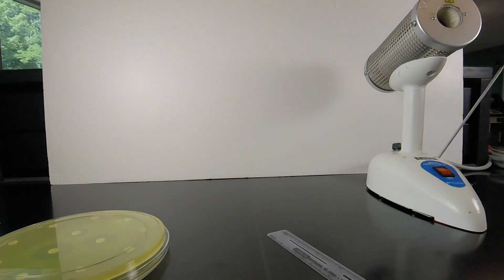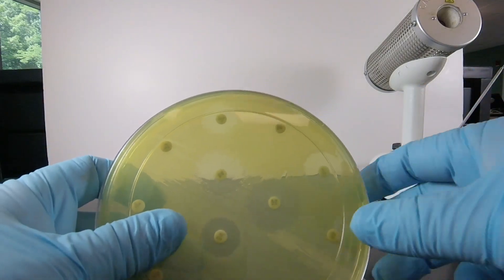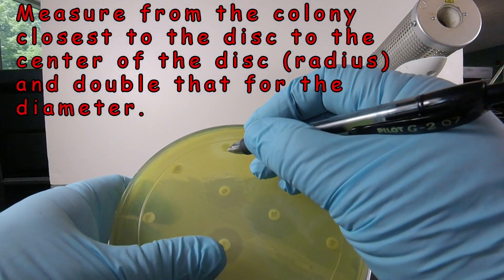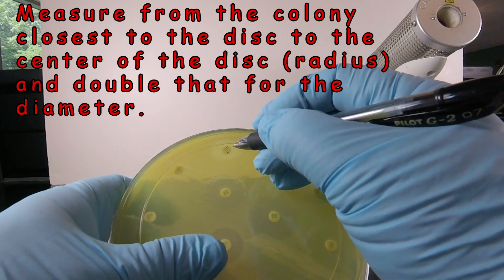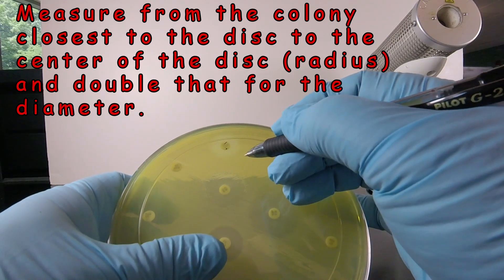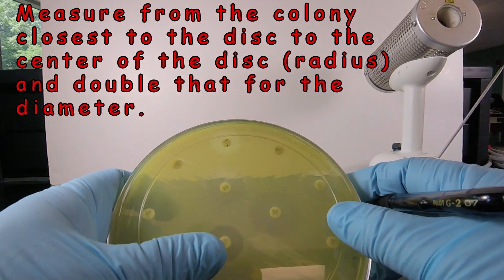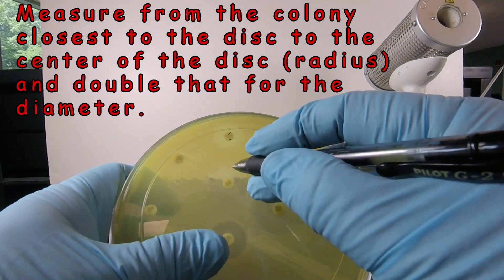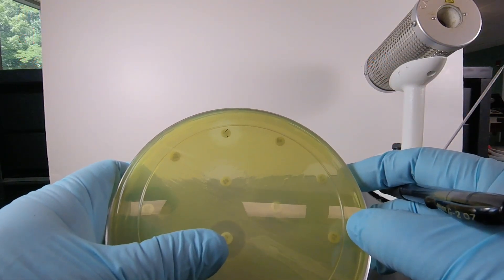If there are colonies in the zone, we find the colony closest to the disc, measure from that colony to the center of the disc to get the radius, then double that to get the diameter — that's what we look up. If any colonies are touching the disc, it's automatically resistant. So whenever we see colonies, find the closest one, measure radius to disc center, then double it for the diameter.